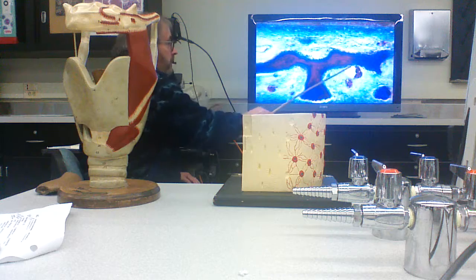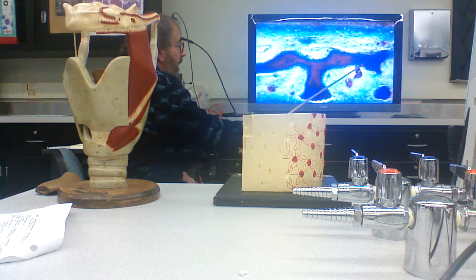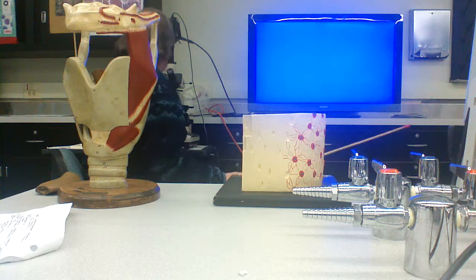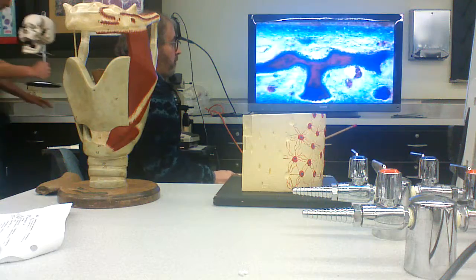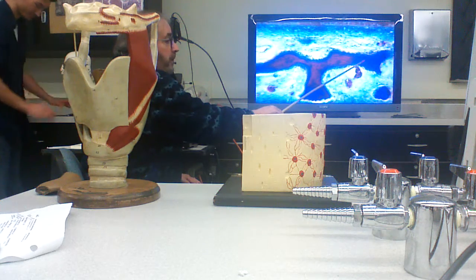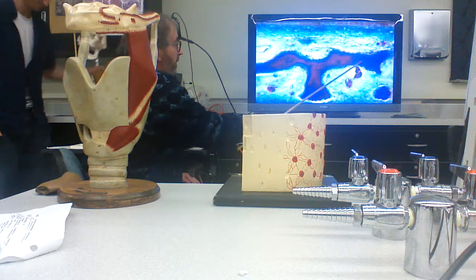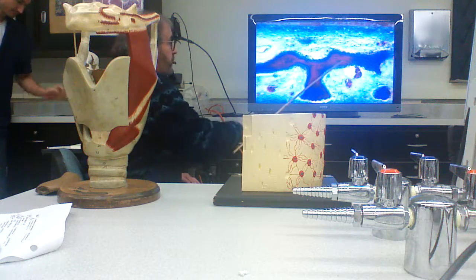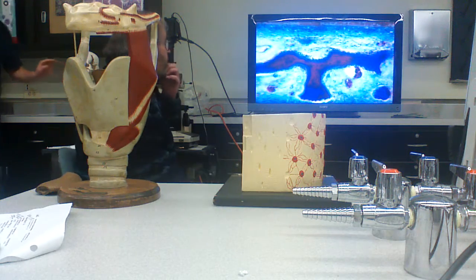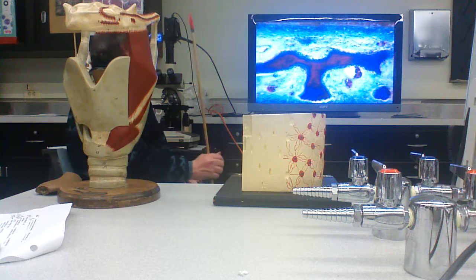They just form pieces of bone matrix. Bone. These are osteogenic cells. They're laying down bones, right? In the form of these little plates, right? Some of the cells get trapped in there. They turn into osteocytes. And then a little bit later on, you can see that the matrix starts to mineralize. That shows up red here in this particular stain. And you've got yourself plates of bone.